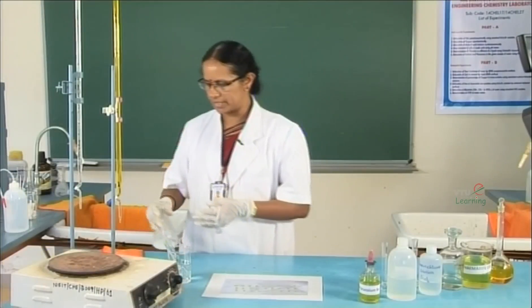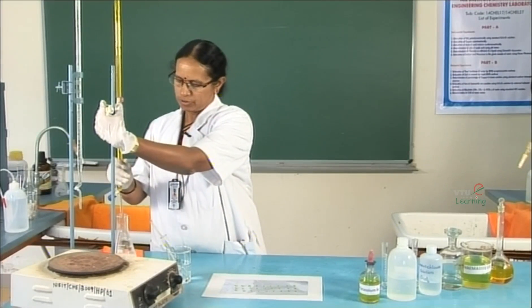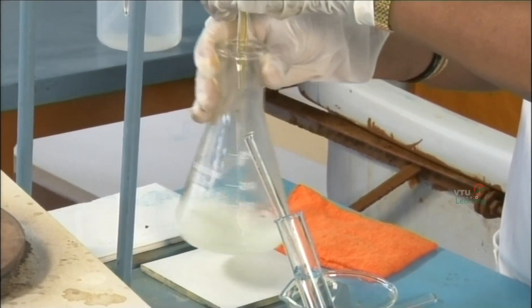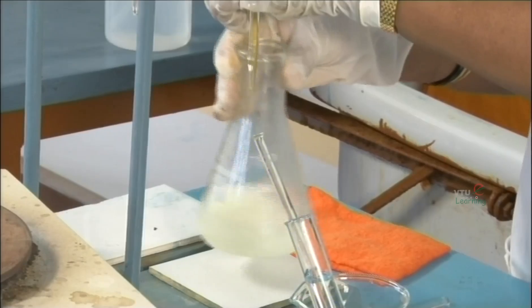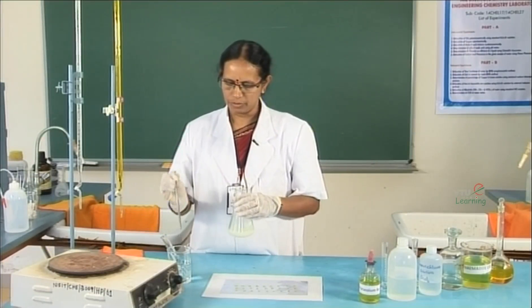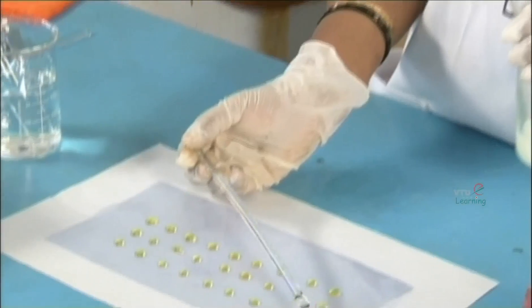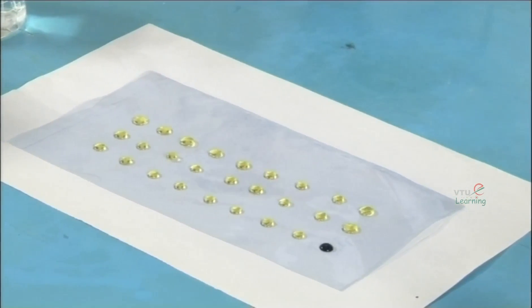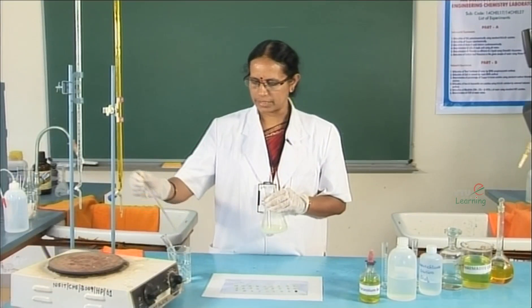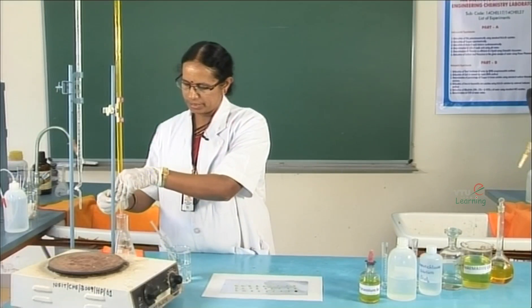The titration is conducted by adding small increments of potassium dichromate, beginning with 1 cm³ additions. The solution is mixed well and with a clean glass rod, a drop of the reaction mixture is taken out and brought in contact with the indicator drop. The solution turns blue due to the formation of the ferro-ferricyanide complex. The glass rod is washed with tap water and placed inside a test tube containing distilled water. By adding increments of dichromate, the titration is continued, testing with a drop of indicator after every addition.